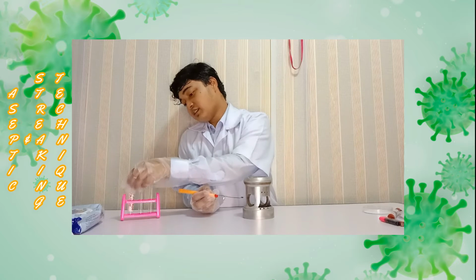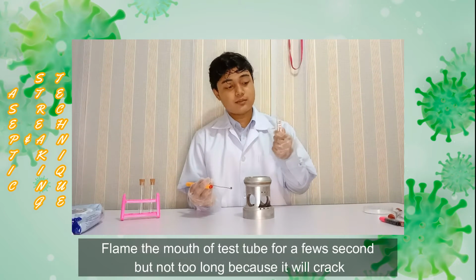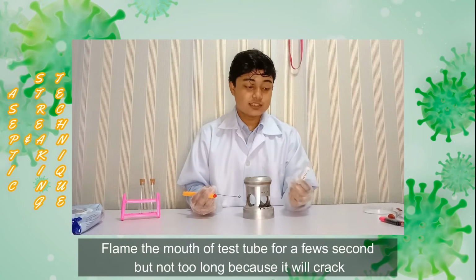Then, holding the loop with our dominant hand, we pick up our mixed broth culture with the other hand. Then we open the cap. After that, we need to flame the mouth of our test tube for a few seconds, but make sure that we don't flame it for too long, because it will cause the test tube to crack.